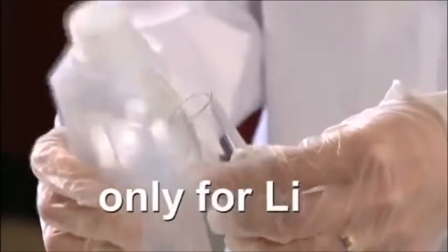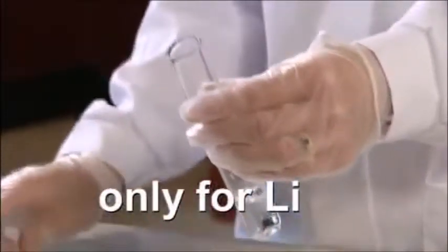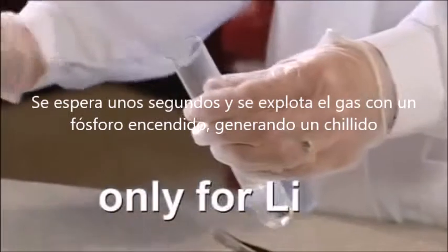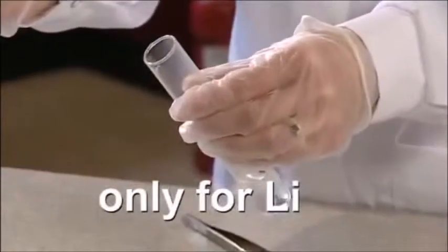To confirm that the gas is indeed hydrogen, add a very small piece of clean lithium to a little tap water in a boiling tube. Wait for a few seconds and pop the gas with a lighted taper. A squeaky pop.